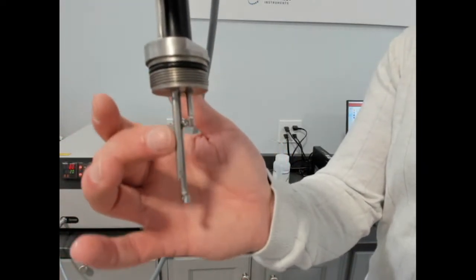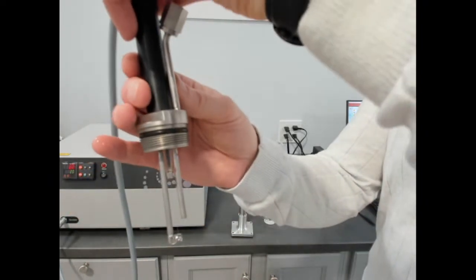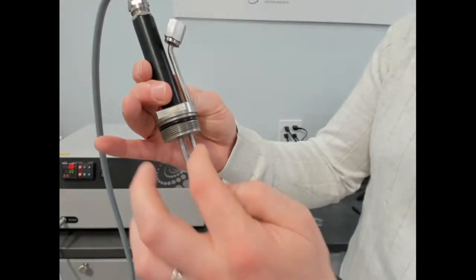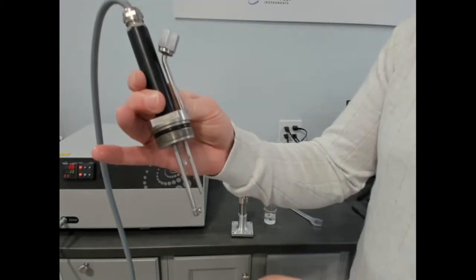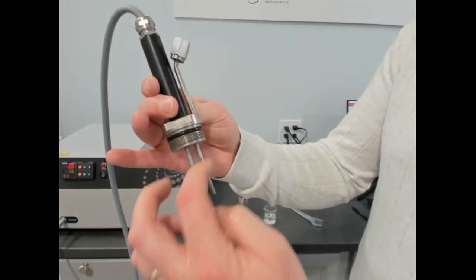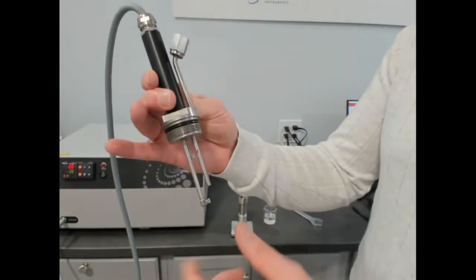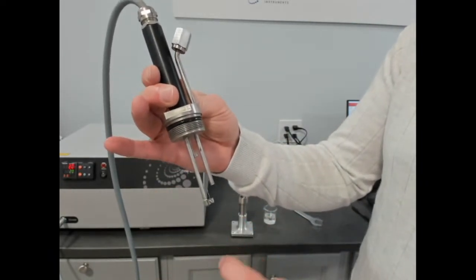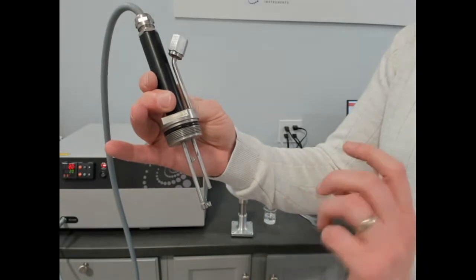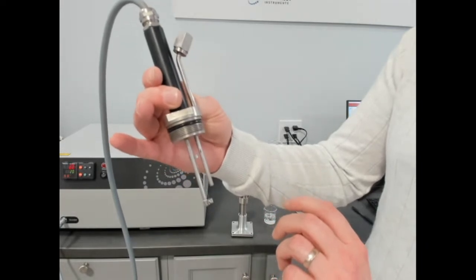What's inside of here is a PT sensor for measuring temperature of the fluid. So in fact, we're measuring the exact temperature of the fluid. When a measurement is done, we pass a current through that platinum wire between those two contact points. This is a 4-wire resistance read with a Wheatstone bridge, and we're looking at the change in resistance related to the heat of diffusion from the wire into the sample, and we get a temperature rise versus time slope, and from that we calculate thermal conductivity and diffusivity. Volumetric specific heat is auto-calculated, or if you input the densities, you get mass-based specific heat.